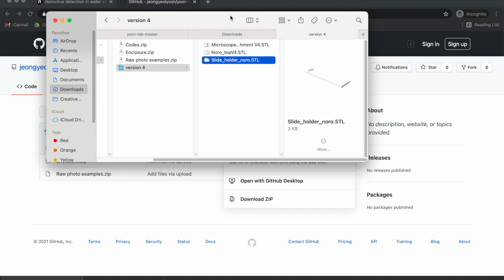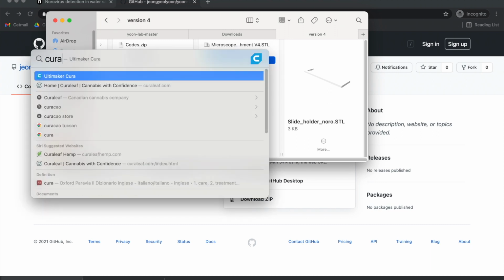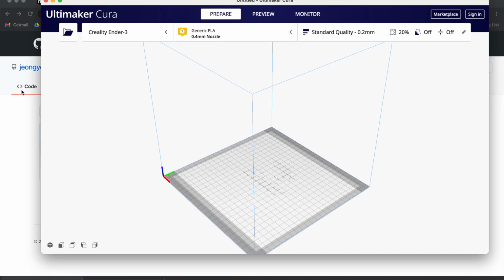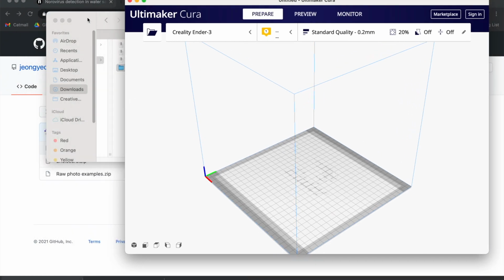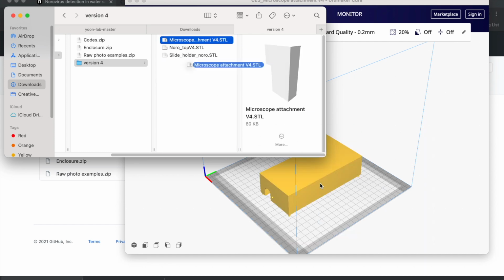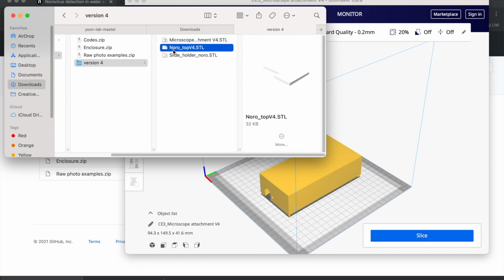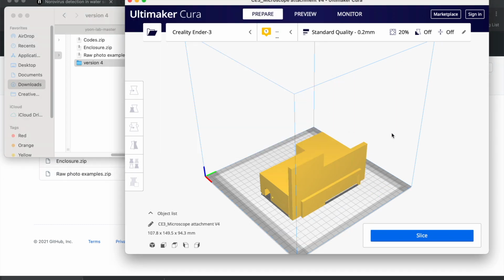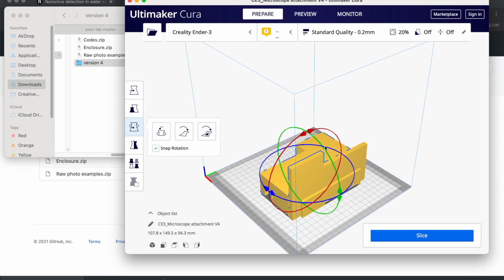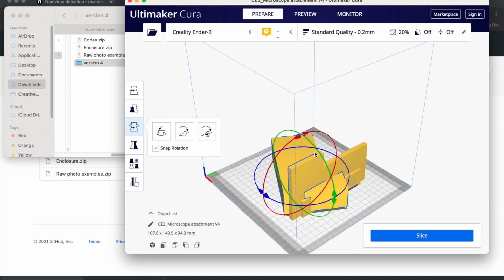If you're printing this yourself though, then you just want to open up, I use Cura, to slice the files. So go ahead and drag them in. Now you can do this individually, you can do this all together. I am not a 3D printing pro. If it works, it works. So I'm just going to show you what I would do to get this thing all ready.